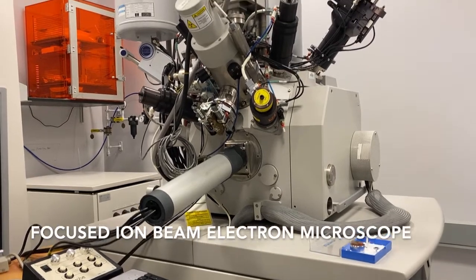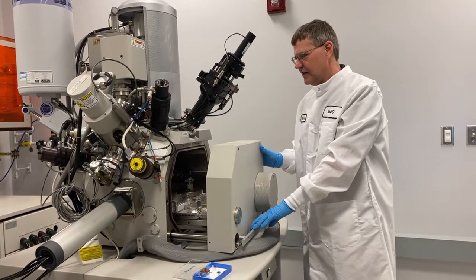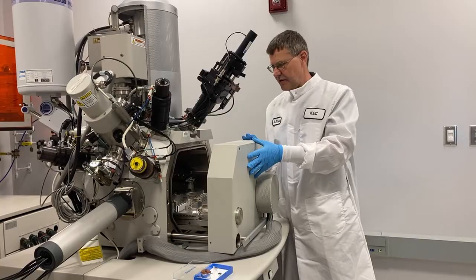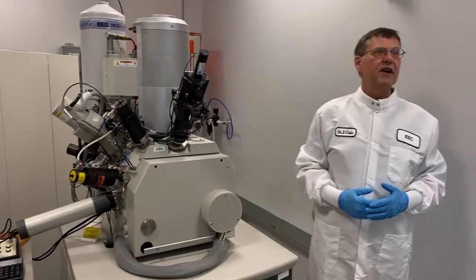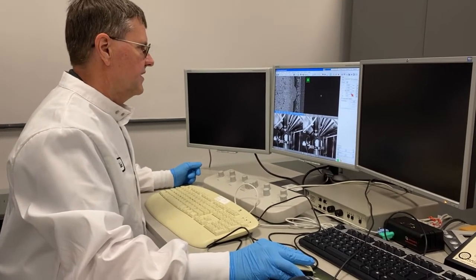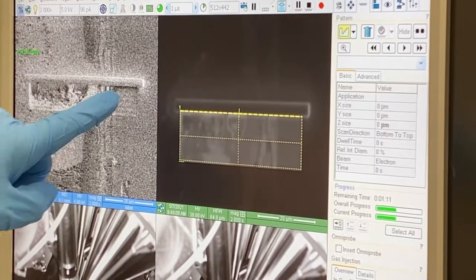That's a focused ion beam and electron microscope, and it is used for analyzing surface features and actually etching into the subsurface areas. It gives high-resolution microscopic images. This particular piece of equipment has resolution in the nanometer range. It's much higher resolution than, say, an optical microscope. With an optical microscope, you are limited to about 200 nanometers tops. And in this case, with a focused ion beam, you're just getting started with that kind of resolution.